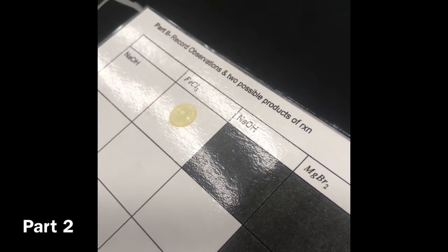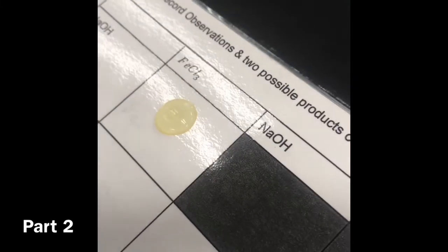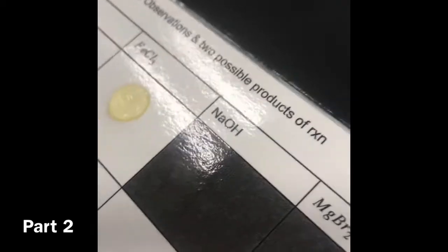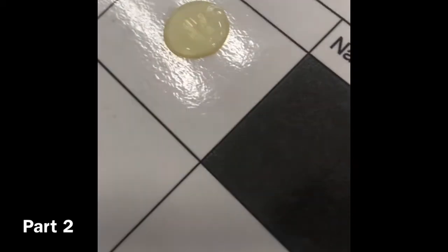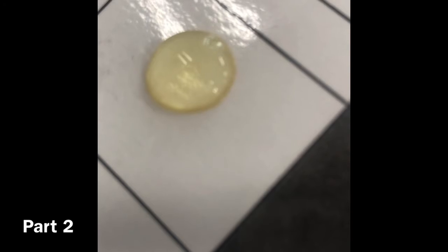Oh. That's awkward. Did anything at all change? I mean, it looks like they just mixed. Wait, interesting. Once again, focus on the data right now. It really looks like this one didn't change. Alright, looks like that's supposed to happen. That did nothing. I don't think it changed.